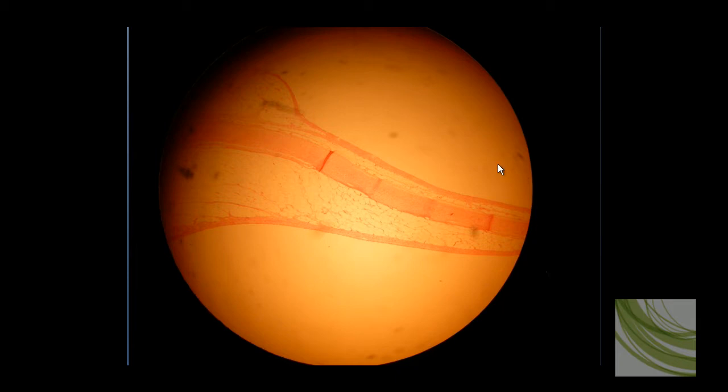Here is one of our hyaline cartilage slides. We are using the 4X objective to look at this tissue. We can see the hyaline cartilage is in a band right along here. It is surrounded by adipose tissue. You can't see a lot of details at 4X, but you want to look at this dark band in the center on this slide.